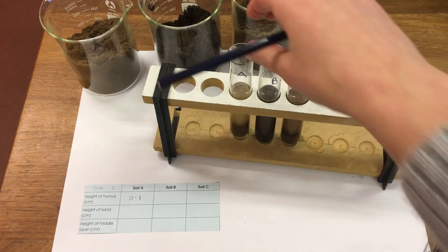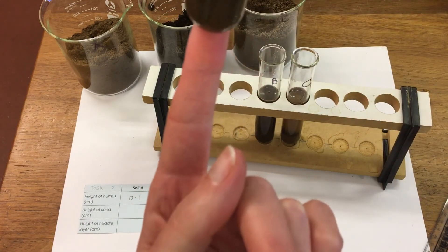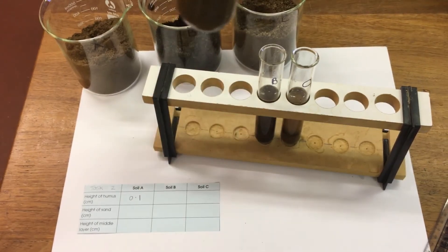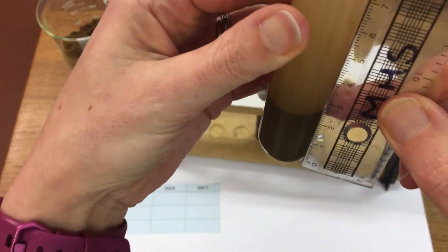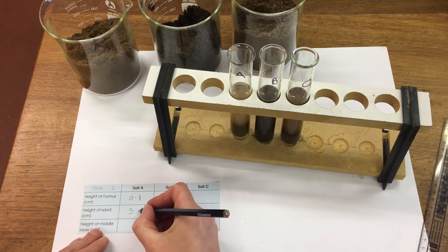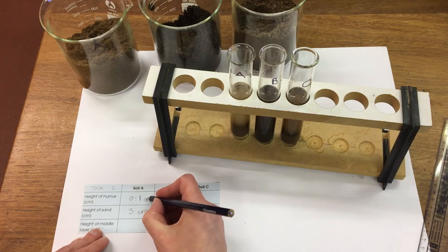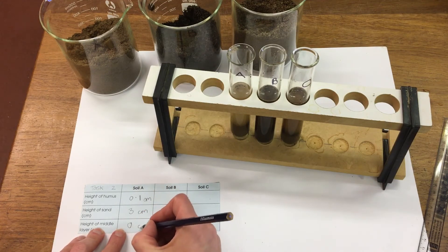And then we've got the height of the sand. It's pretty much all sand in this sample, so the height of that is 3 cm. It doesn't really have a middle layer so we're going to put 0 for that one.